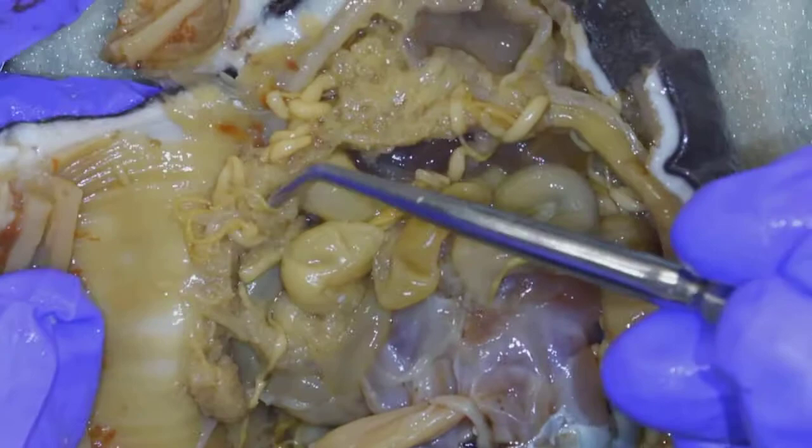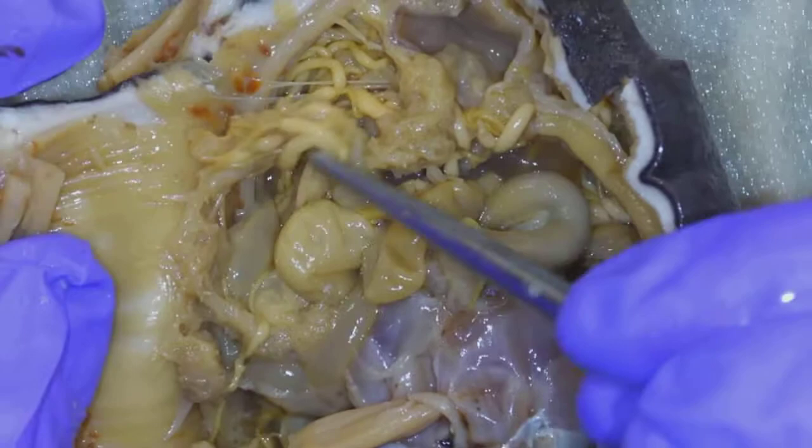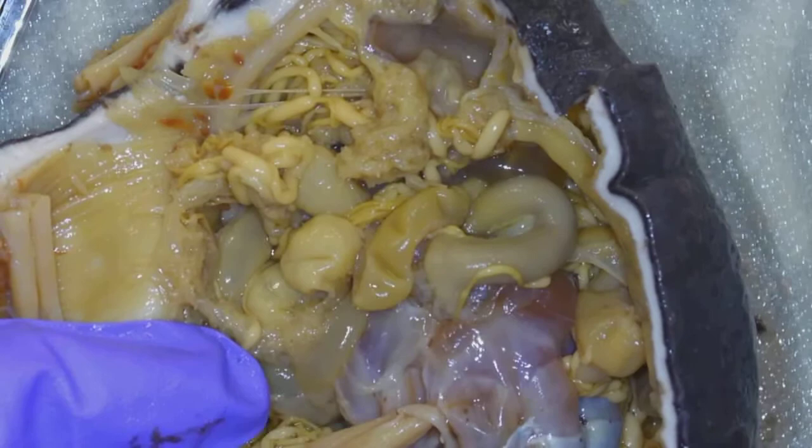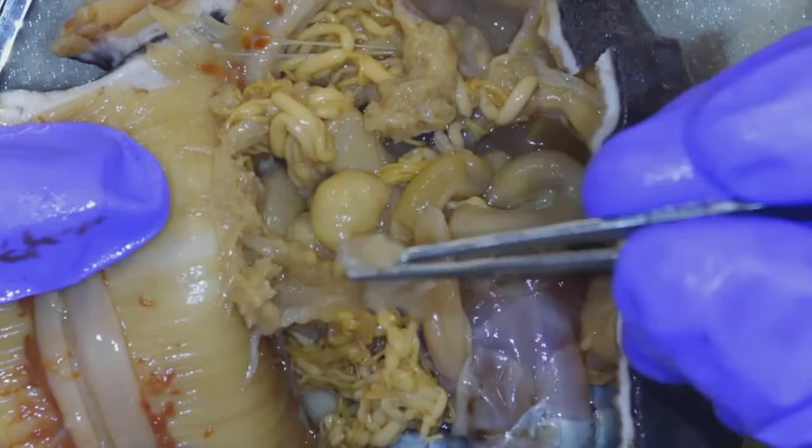Other things in here — you've got all this spaghetti-looking stuff. What we have here is both respiratory tree and gonads in this yellow material. The best way to tell them apart, because it looks basically like chow mein with all these very fine noodles, is a technique I'll demonstrate.